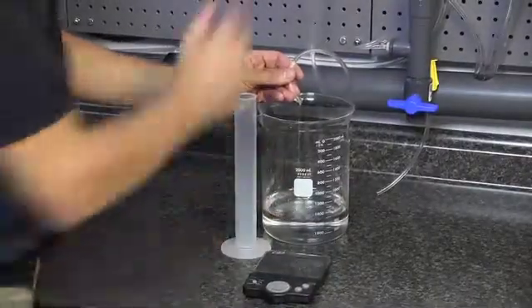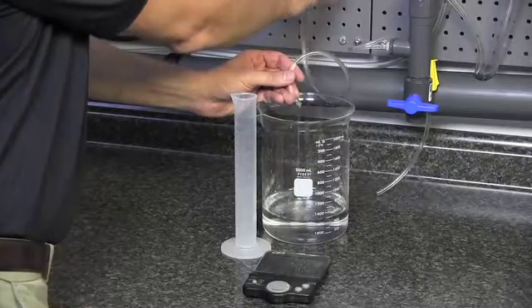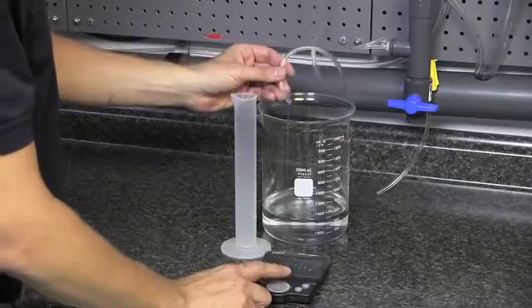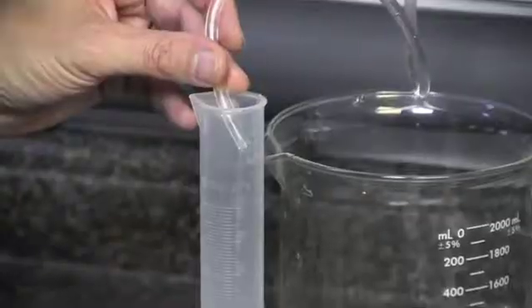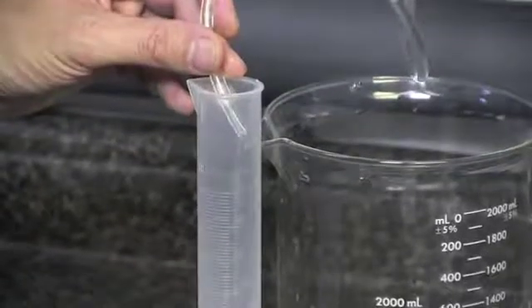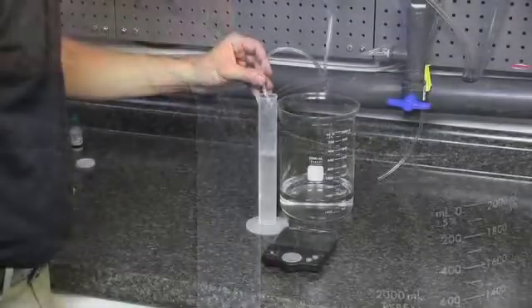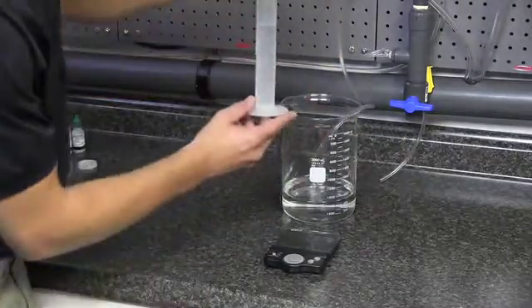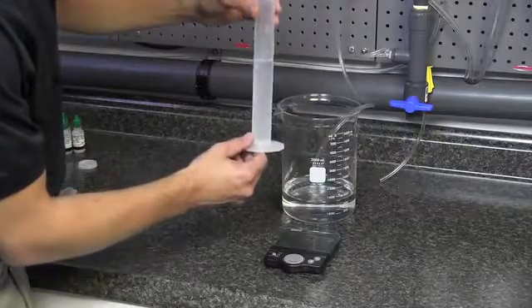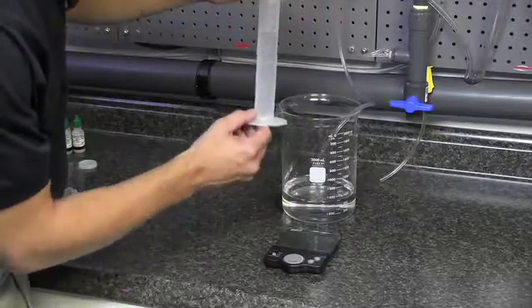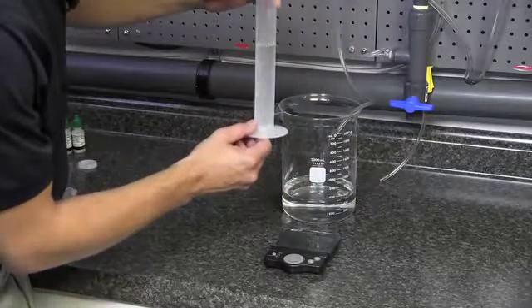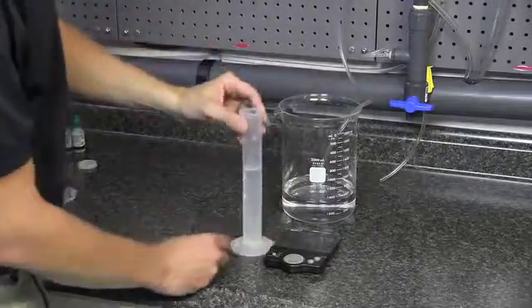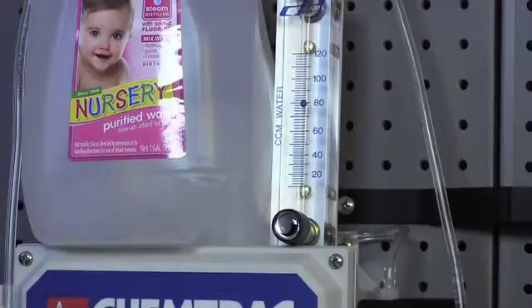We're going to make sure that our flow meter is showing 75 mils per minute, what we think is 75 mils per minute. Then we're going to start our stopwatch and start measuring the flow. And there's one minute. Then we can look at our flow. In this case, we're actually just a little bit under 75 mils per minute. So the bottom of the ball is not directly correlating to where the flow needs to be. So we'll just simply redo the test until we find what point actually gives us the 75 milliliters per minute mark. We don't have to be dead on at 75, but preferably 74 to 76.